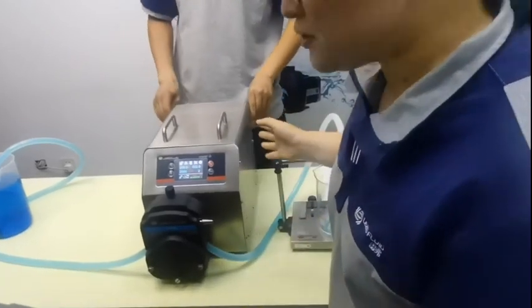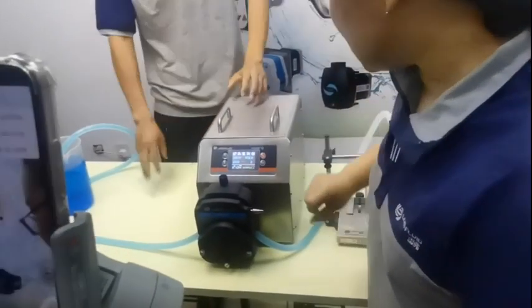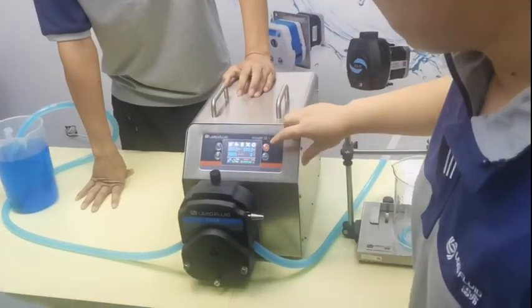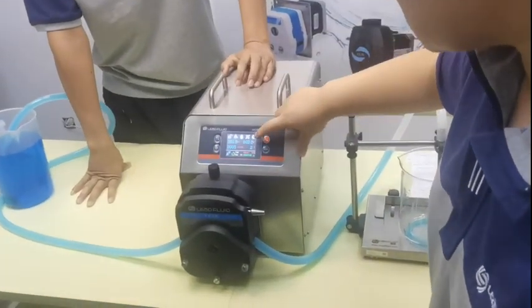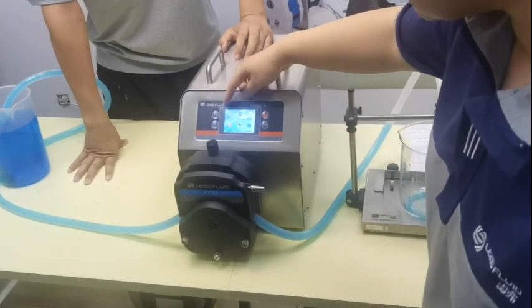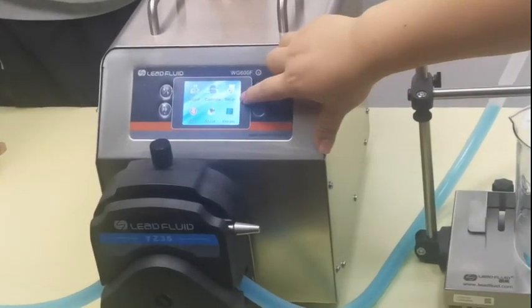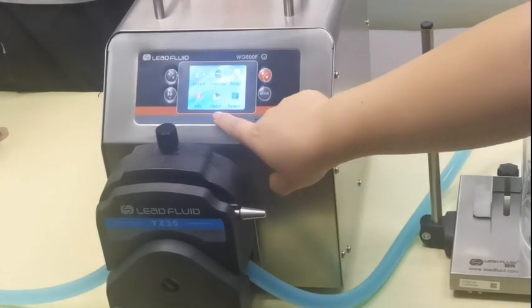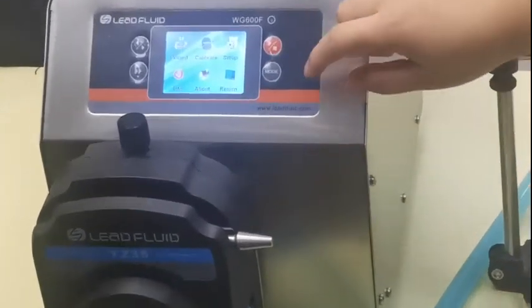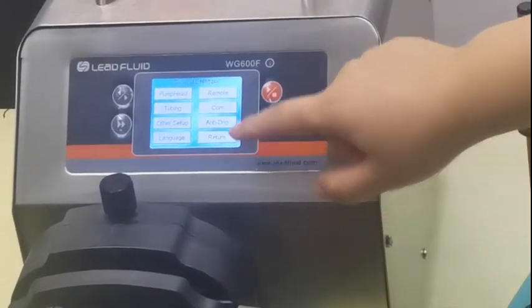Let's start — how to use the pump. This is setup information on the screen. To get into setup, you need to choose the first option.